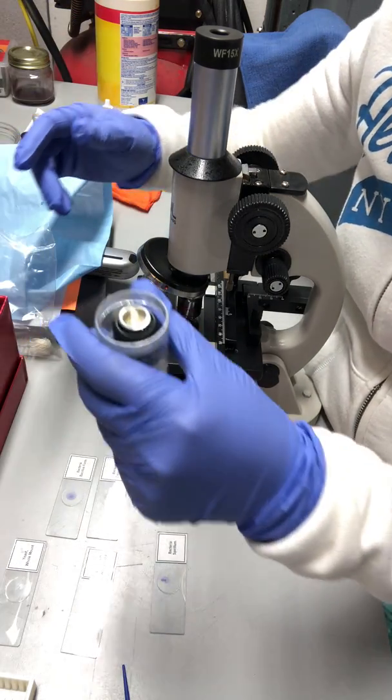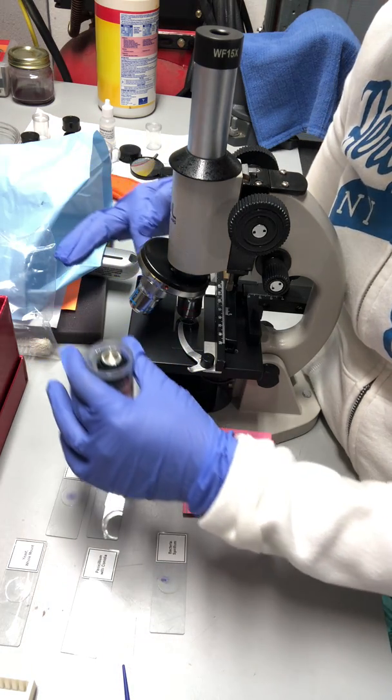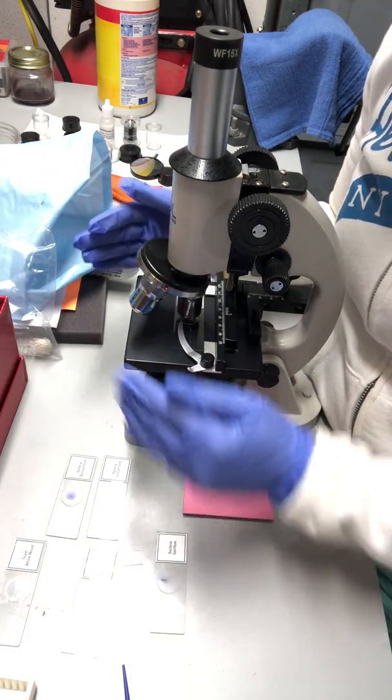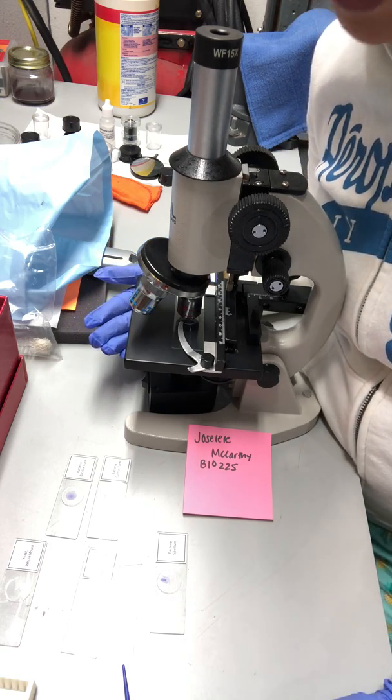And also at the same time, we have to change the scanning lens with the immersion oil lens, and to see which one gives the best picture, and we were asked to explain which one and why not.